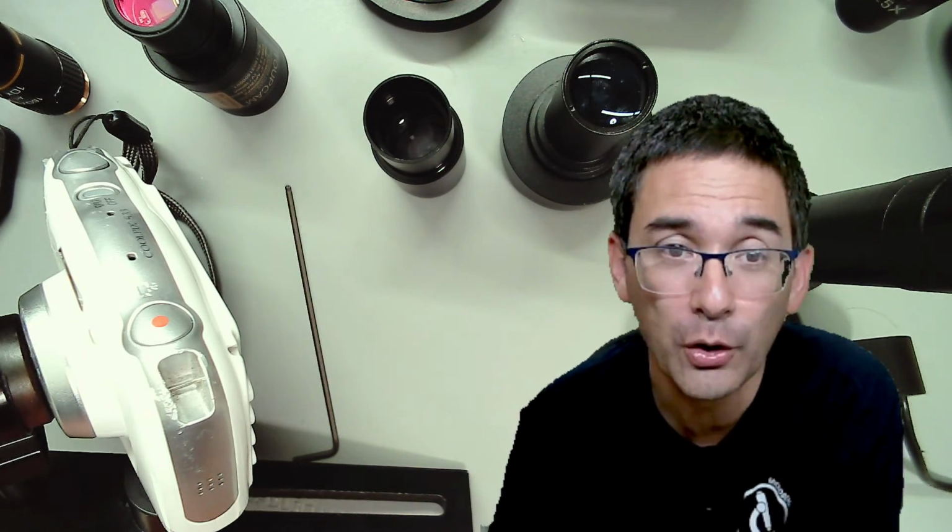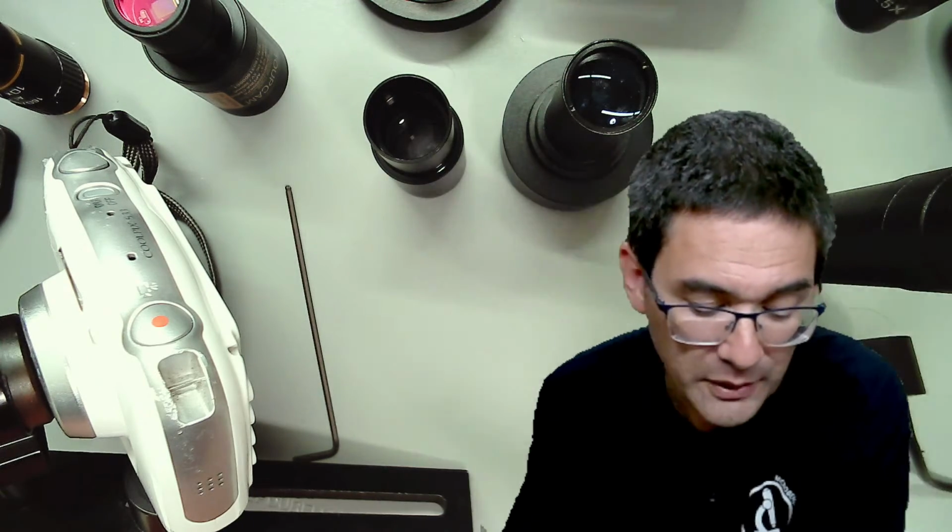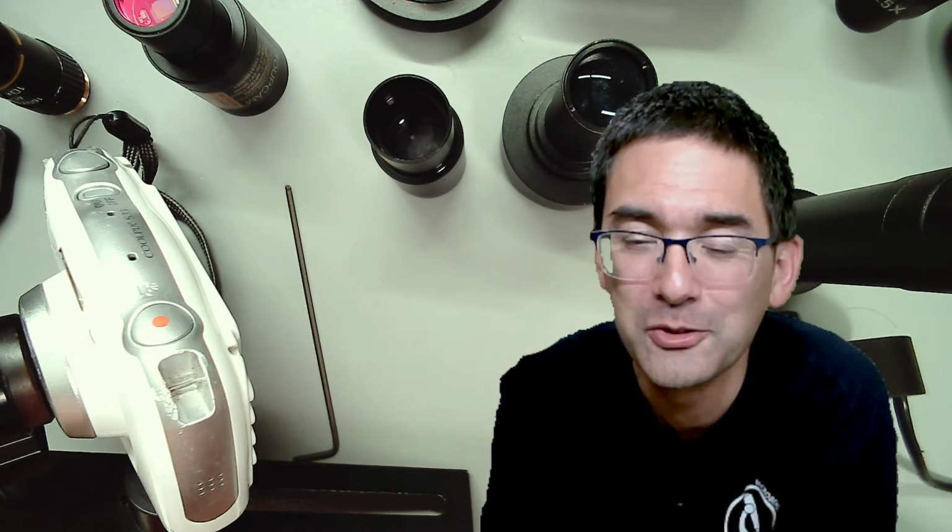Yeah? So there are solutions available, but today what I've been doing is simply giving you an overview of, I would say, maybe the more affordable solutions that there are.